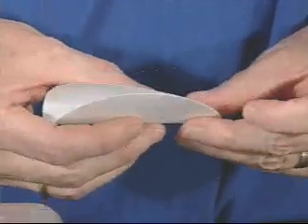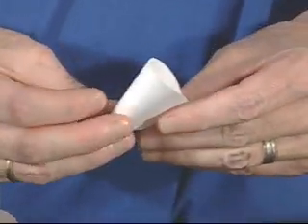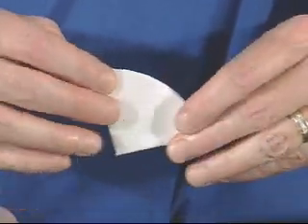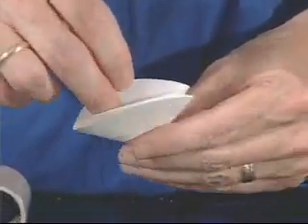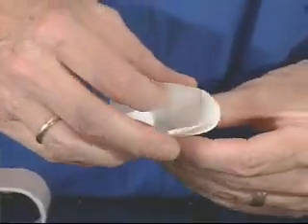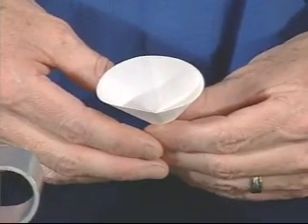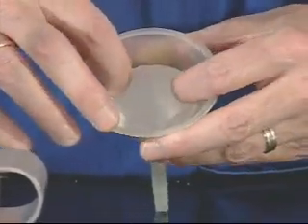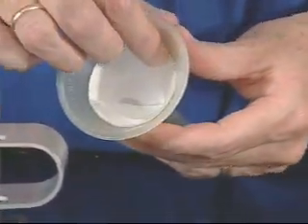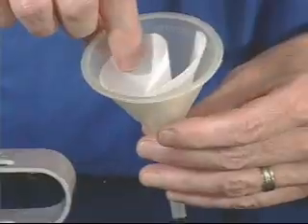Now that you have finished weighing the evaporating dish assembly, you need to prepare the filter to filter the salt water solution. Take a piece of filter paper and fold it in half to make a semicircle, and then fold it in half one more time so that it's in quarters. You can then open the piece of filter paper with three thicknesses on one side and one thickness on another so that it forms a cone, and then simply put that cone down into the funnel. At first it might pop out a little bit, but as you put water into it, that will cause the filter paper to adhere to the funnel a little bit better.